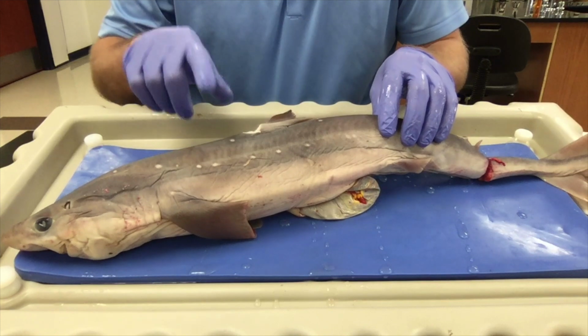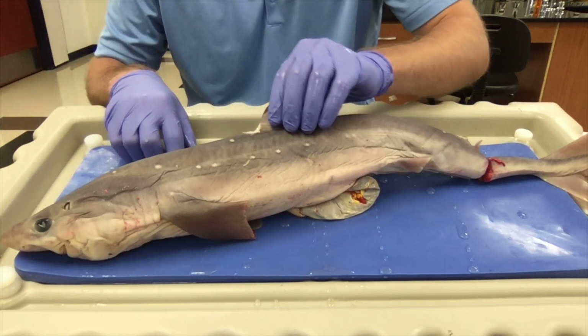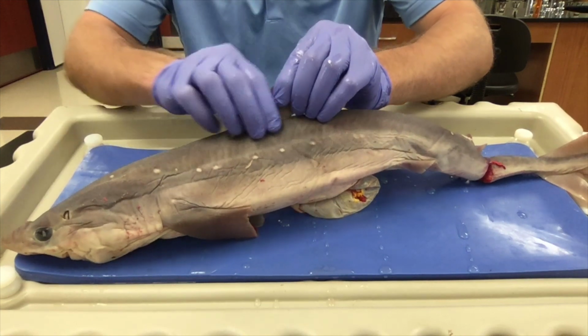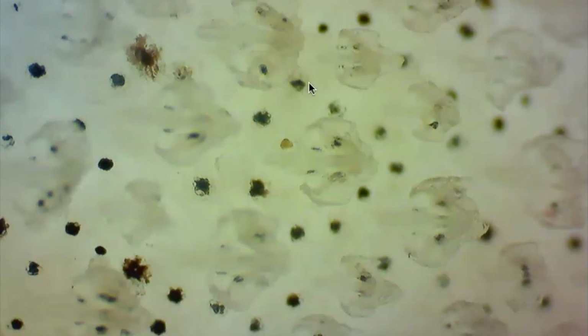Their scales are sort of trident-shaped, facing backwards, and are used to help them be more hydrodynamic, swimming through the water at a quicker speed. If we look at a piece of shark skin under the microscope, we can see the individual placoid scales. They're sort of sharp, facing back towards the tail, allowing the shark to swim faster through the water and be more hydrodynamic. Then we can also see lots of pigment cells. That's all of these darker cells. They give the shark its color.